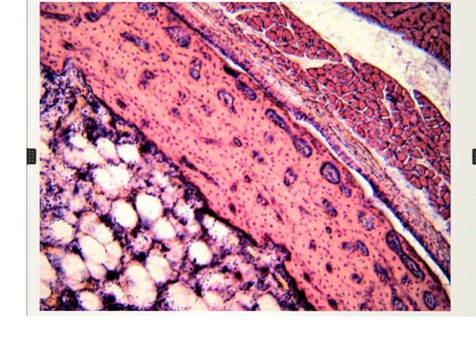On the inner side here, you can see the bone marrow. The bone marrow is diagnosed by the presence of these empty spaces representing the fat cells, and these dots representing the hemopoietic tissue. The skeletal muscles are diagnosed by these polygonal transversely cut fibers, and the nucleus is peripheral in position.